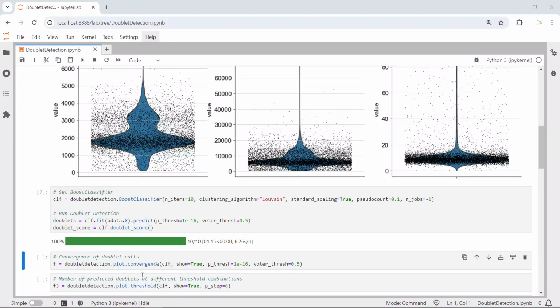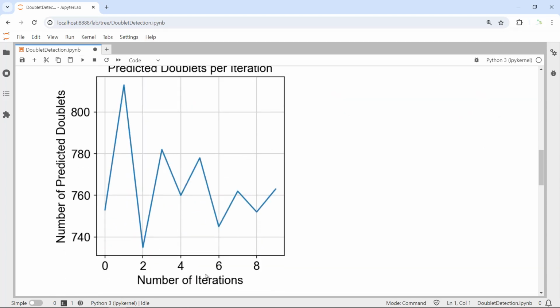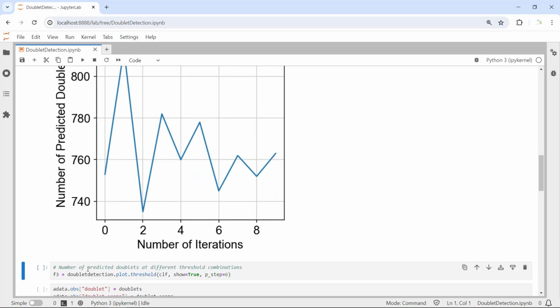First we can plot the convergence to see the doublet numbers according to different thresholds. Let's make the plot. Okay, you can see here is the number of iterations against the number of predicted doublets. You can see iteration 1 has the highest doublet count. It is over 800 doublets in this dataset. So next, we can look at the number of predicted doublets at different threshold combinations. This is a heat map. Let's run the code to generate the heat map.